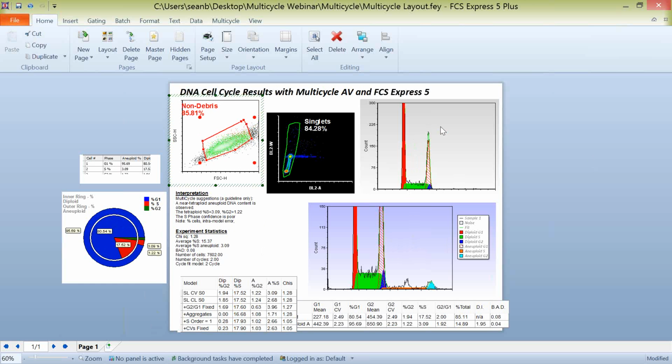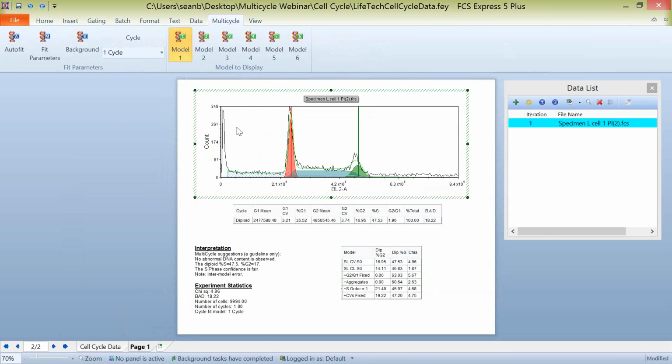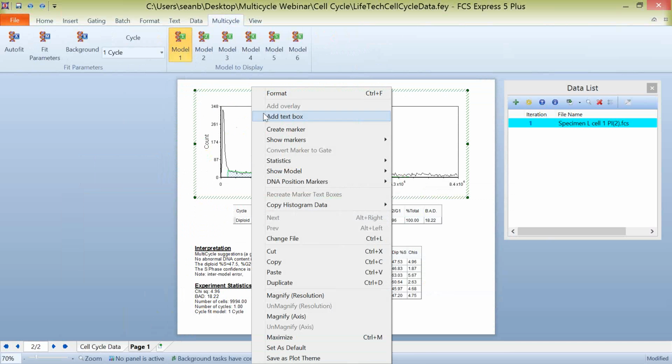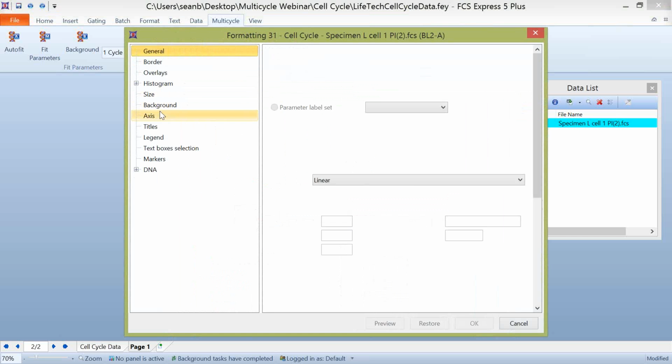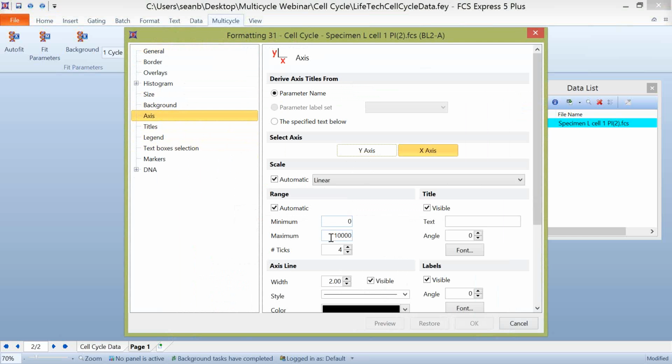You can also notice that when we look at this plot versus this plot, we've actually zoomed in on the axes here a little bit. When we're looking at some of these lower frequency aneuploid populations, or maybe even your diploid is a lower frequency than your aneuploid, you can change the formatting on these axes. You can change anything about these plots that you like, but if you right-click on your multi-cycle plot and choose Format, a very common thing that people do, again, is zooming in.